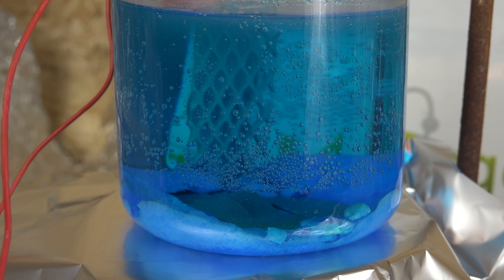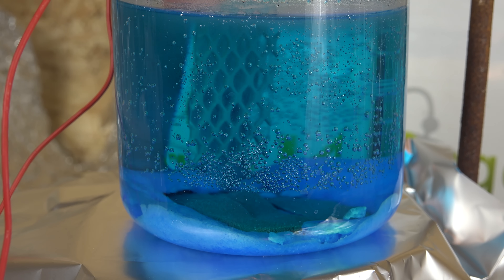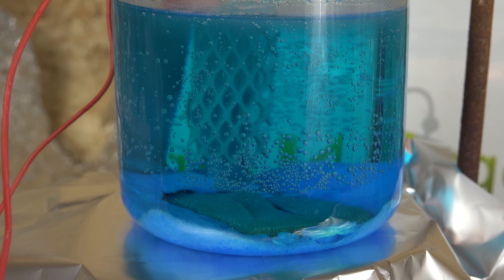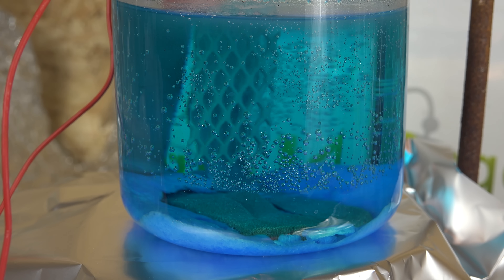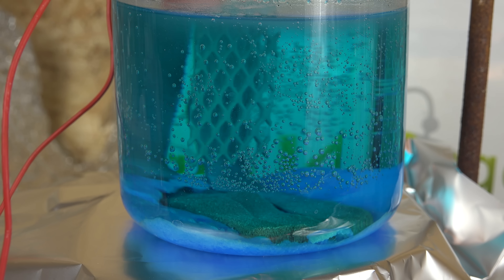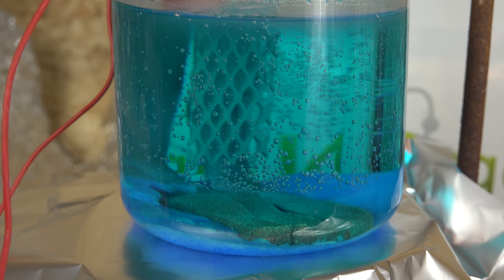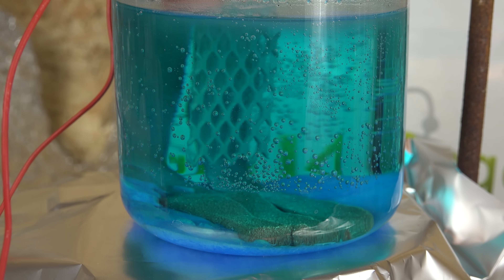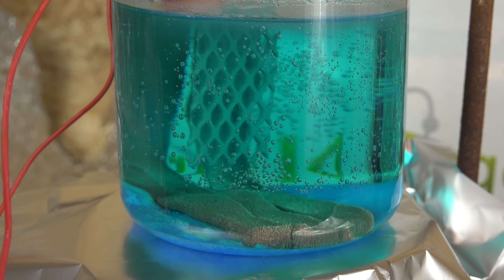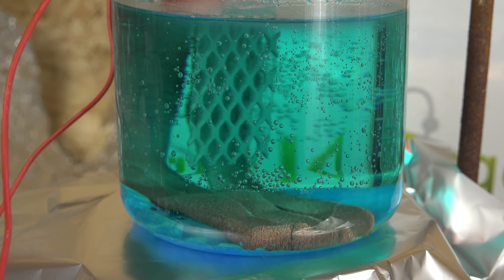The process is very slow and could take days to finish. To speed it up you can use more electrodes to increase the surface area and thus allow you to apply more current. I'm just using one small platinum electrode, but if I was doing a large scale operation I would use very large or even multiple electrodes for both the anode and the cathode and apply large currents of many amps. I would also use direct stirring like vigorously bubbling air into the mixture to ensure high speed mixing. It can be done in mere hours or process kilograms of metal. Another thing I should mention is that the bubbling of oxygen gas will make the solution spit out tiny droplets of electrolyte. So you may want to put a cover over the cell to contain the spray, or even put your electrolysis cell into an electrolysis box as I showed in an earlier video.